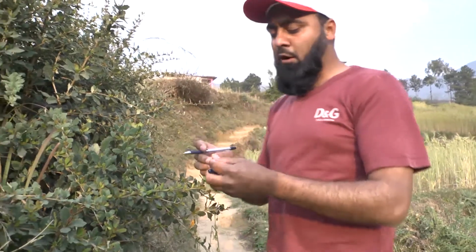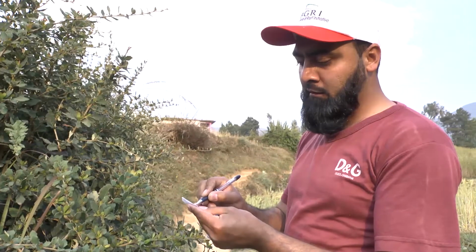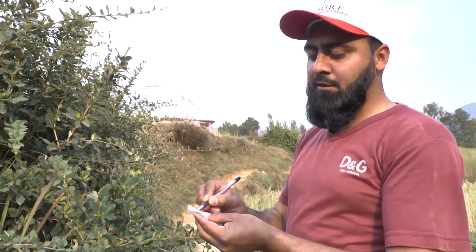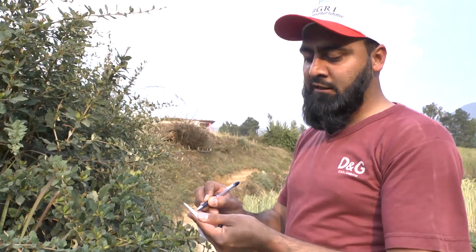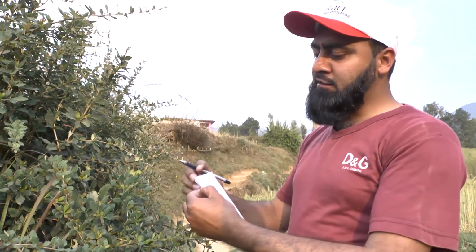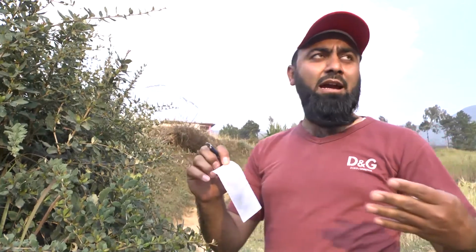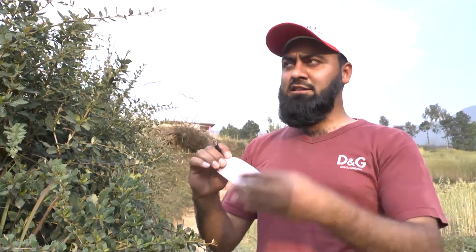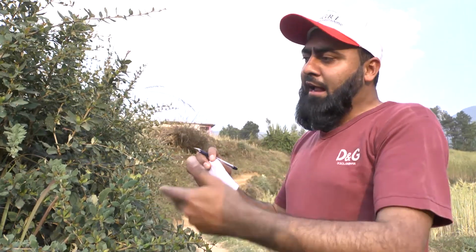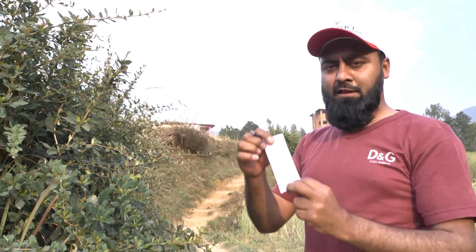Then you would like to make a proper code of the sample. So like here I'm in Nepal and I'm in a location, so I give this location 1 and this is sample 1. I put the date, right? And then in an Excel file, this code NP11 will have a specific meaning with which I will write the name of the place, the date, the GPS data, the infection severity on the barberry plant, and any other information which could be used later on. And that file will go with the samples.